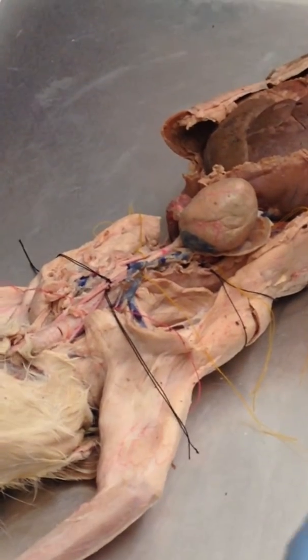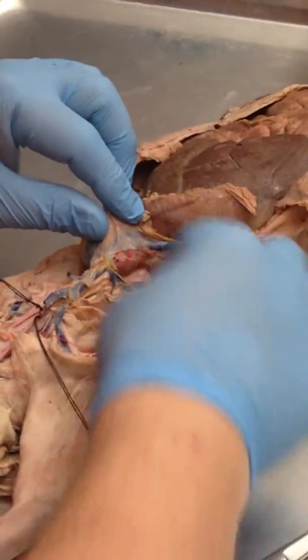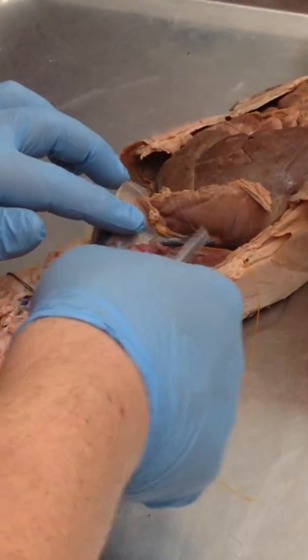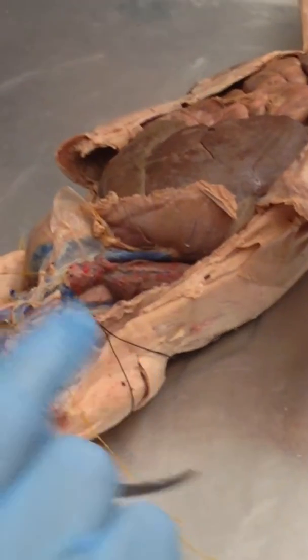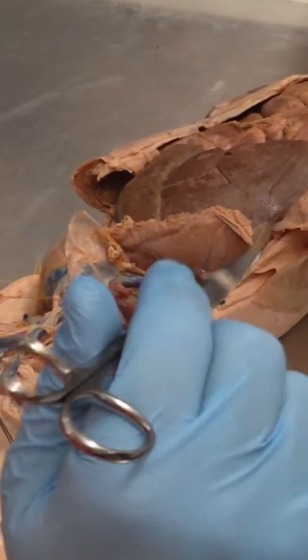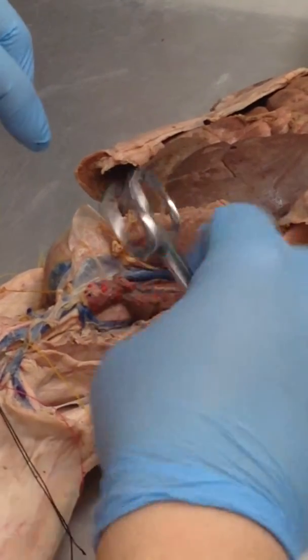Now the sympathetic trunk, it's usually a challenge to see, and I do have it labeled in this one. If you remember your spinal nerves, as you go up and down the vertebrae, spinal nerves exit and go out horizontally. All right, the sympathetic trunk runs vertically, basically connecting all those nerves. That's your sympathetic nervous system. So the sympathetic trunk here is this black thread.